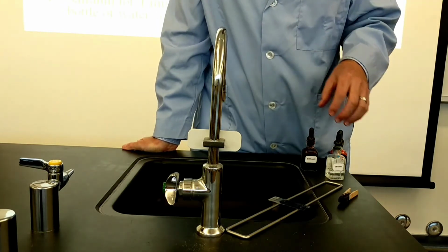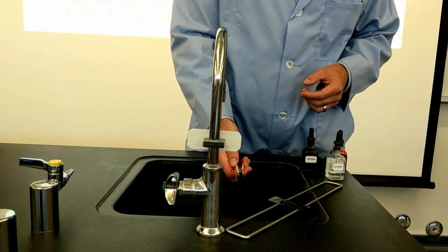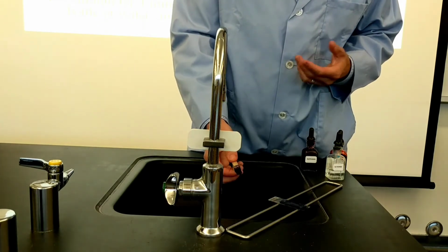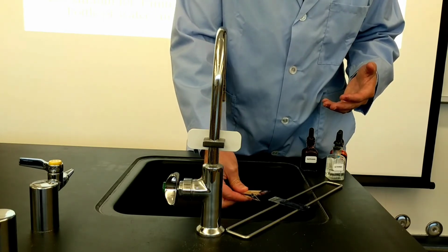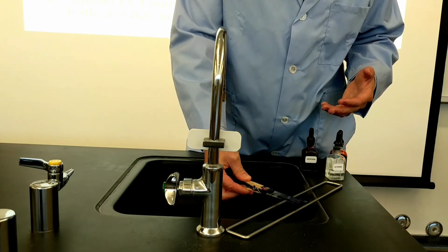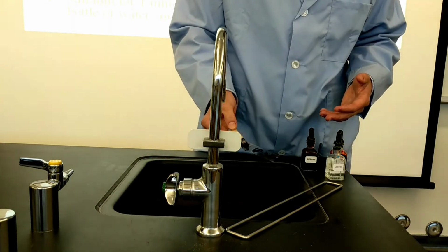So I'm waiting the full 30 seconds, and during that time I'm going to use a clothespin or whatever other device you can use as a slide clip. I don't want to get the hydrochloric acid on my fingers. That would burn my skin, and I don't want to see anyone burn their skin or their hands. If you did get this on your skin, you could just wash it off right away. It's not a super strong solution, but I'm going to dump off the hydrochloric acid and shake off any excess.